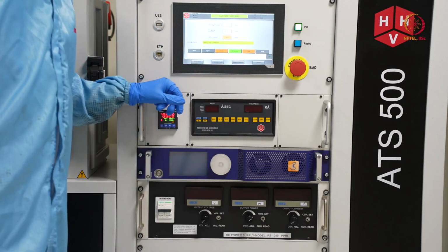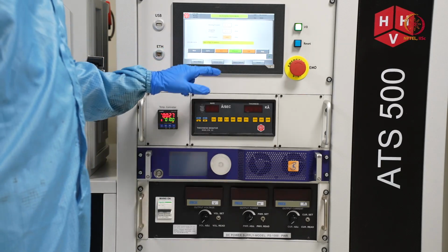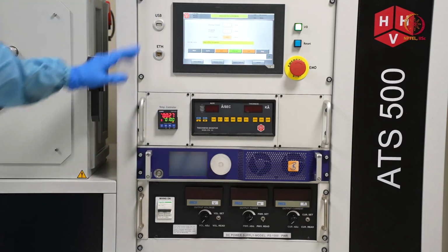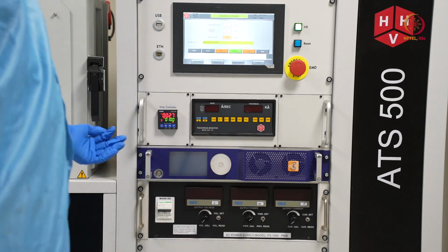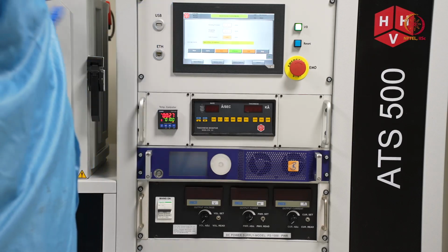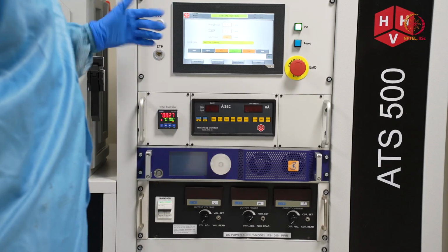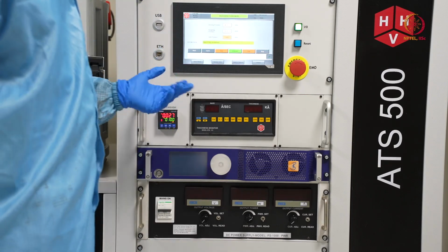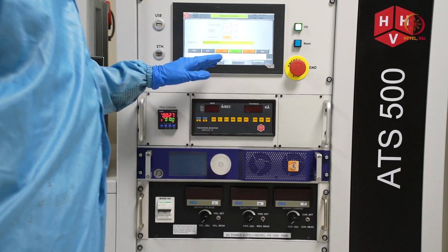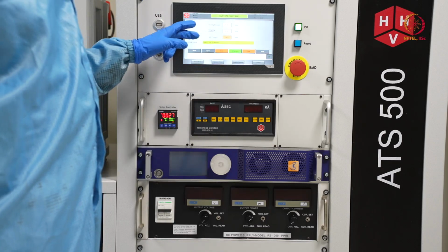As the deposition is done, here we are waiting, and this is at throttle pumping state. You no need to focus on the other things because you already know that these are switched off. We will focus more on the system control part now, and after that we will go to the chamber to see inside what happened already. Let us check from here. Still it is in throttle pumping stage.